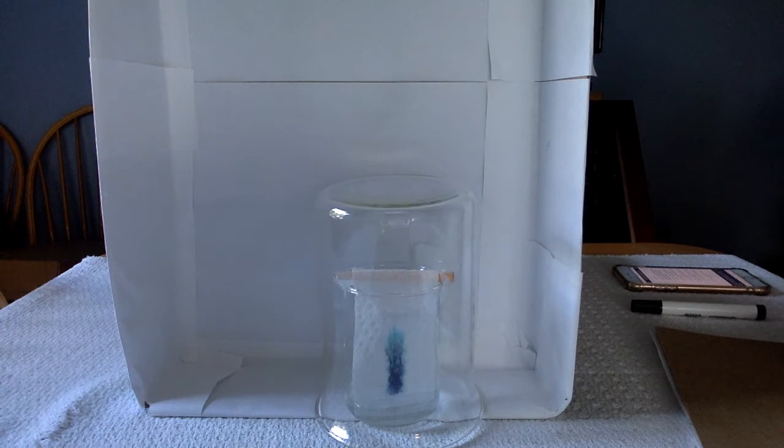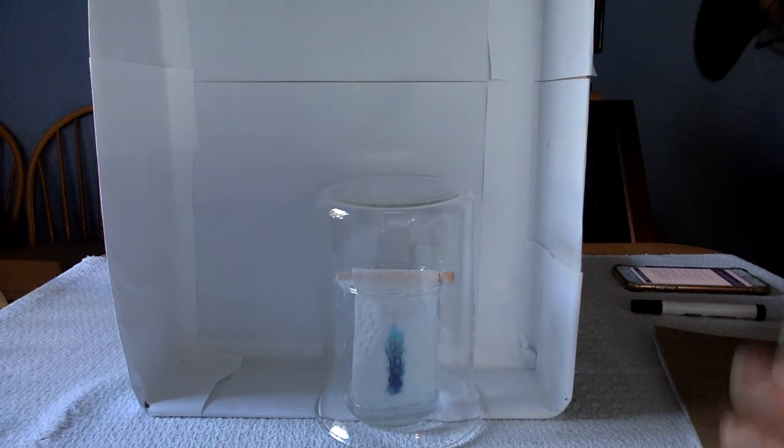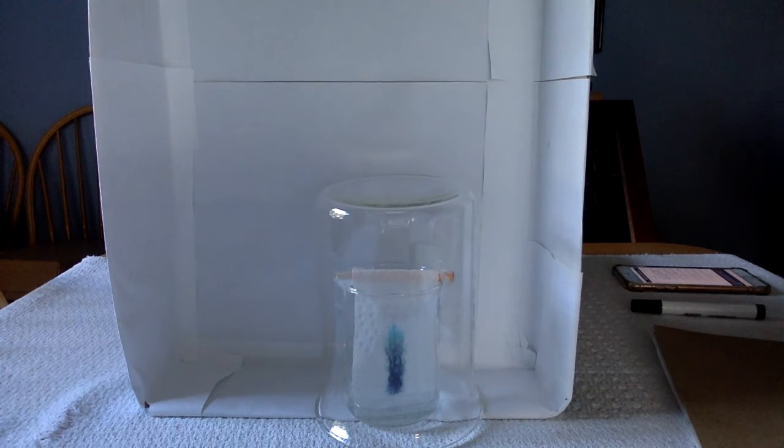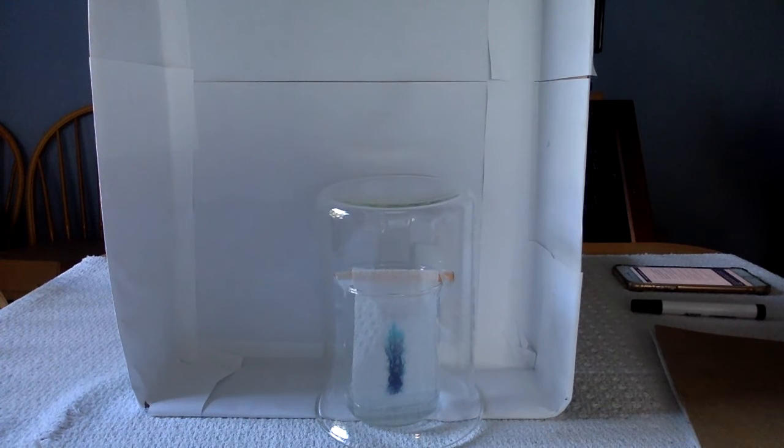And we can do some measurements. That's how you would really do it if you were doing it in a chemistry lab to identify substances. You would already know how far a particular color moves with the water, so we would know what was going on.